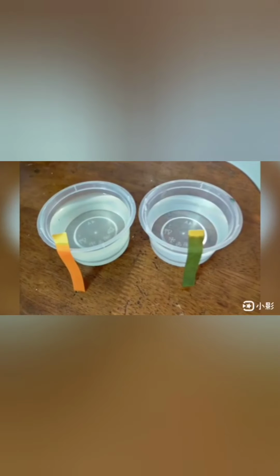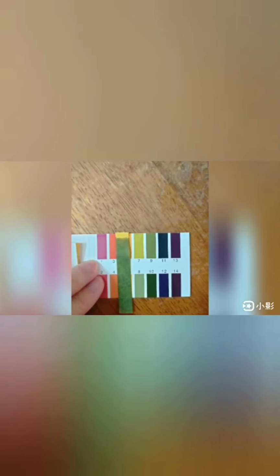The wastewater with alum added gives a pH of 4, while the treated wastewater gives a pH of 8. Through this experiment, I understand that the major aim of the filtration system is to remove as much suspended solids as possible in the wastewater. The filtered water from this experiment may be reused for toilet bowl flushing.